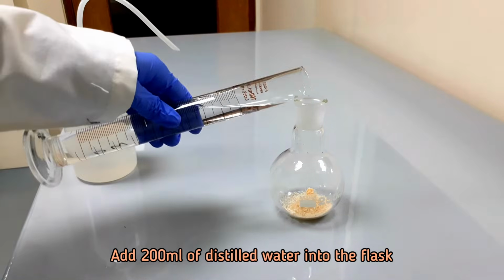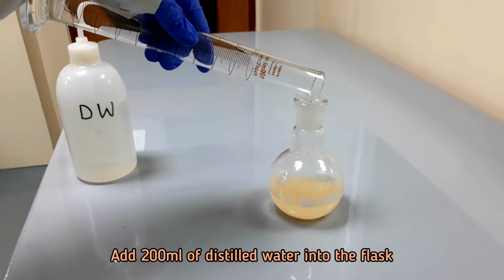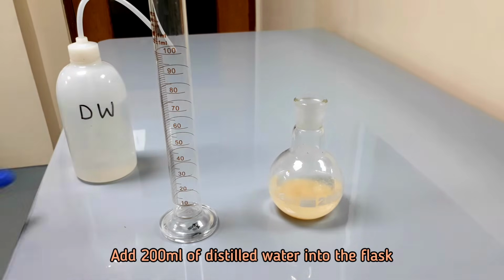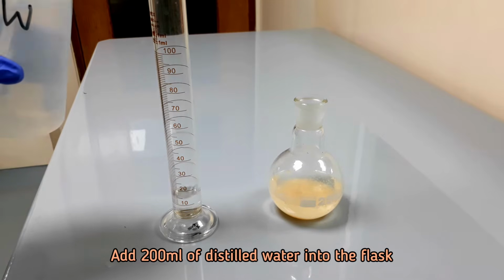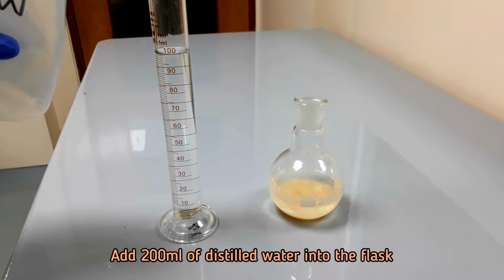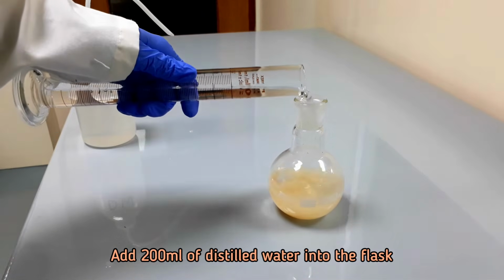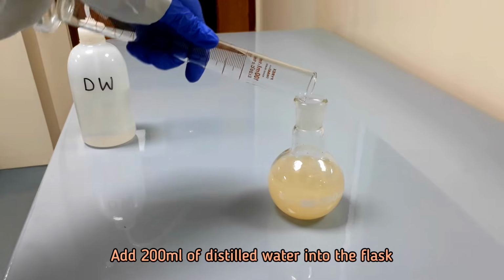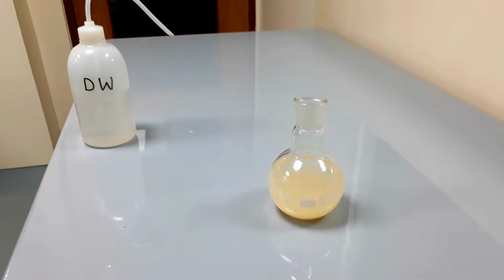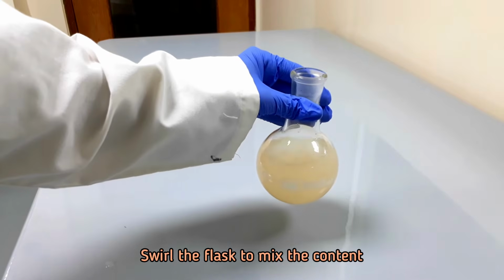Add 200 ml distilled water into the flask. Swirl the flask to mix the content.